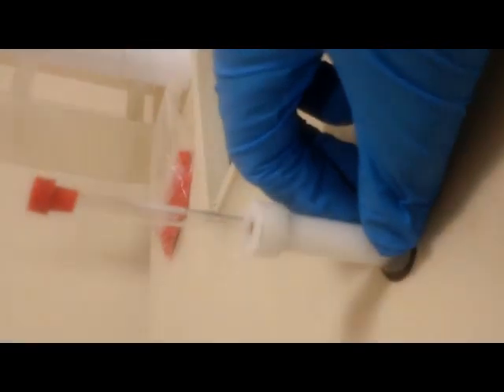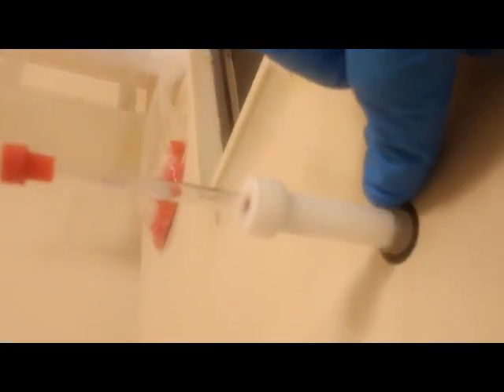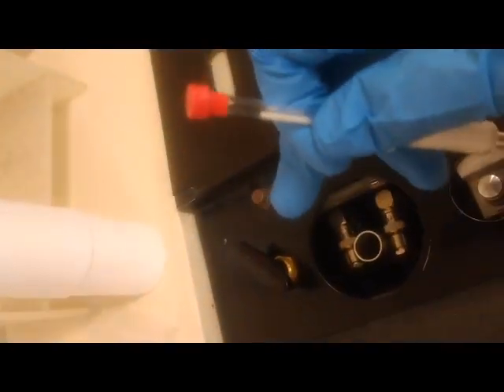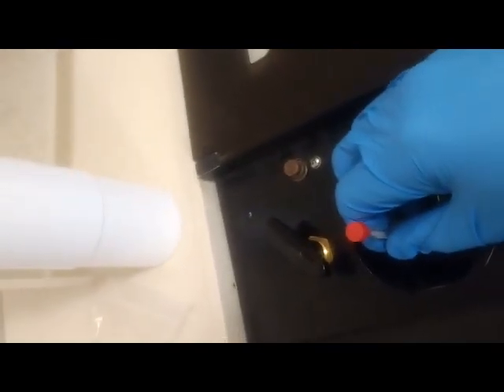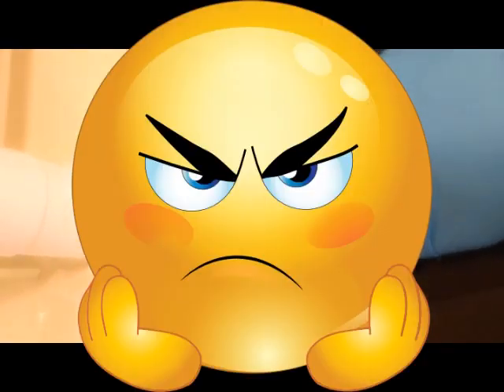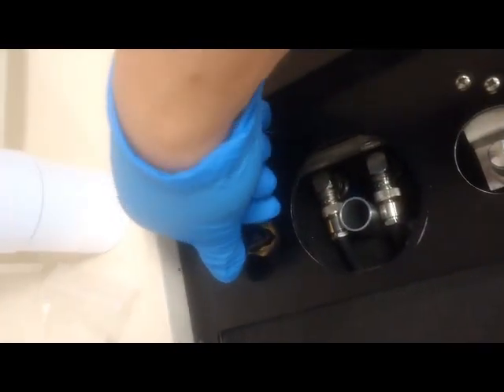Here's the gauge right next to the NMR machine and what you want to do is to carefully insert your NMR sample into this hole. And you will want to make sure that the sample holder is nice and flush with the gauge right here, height gauge. And now this is ready to be inserted into the NMR machine. And remember to keep the air compressor valve open. It's hissing air right now. Without the air coming out, if you put the sample in, it will just drop and the glass will break inside the machine. That would be a horrible tragedy and I definitely wouldn't be happy that day. So you will want to put this while the air is coming out and notice it's floating. And then if I slowly close the air valve, the sample goes into the machine.